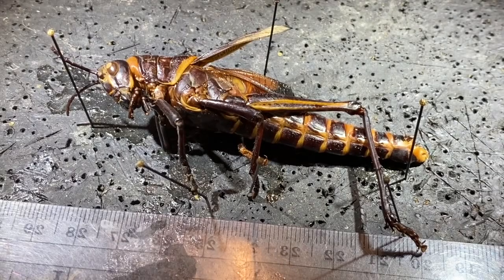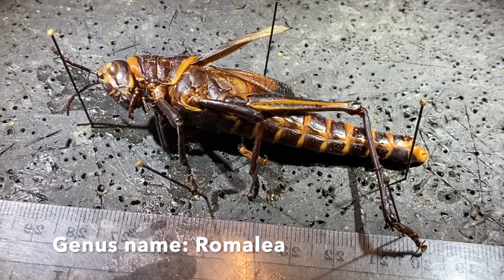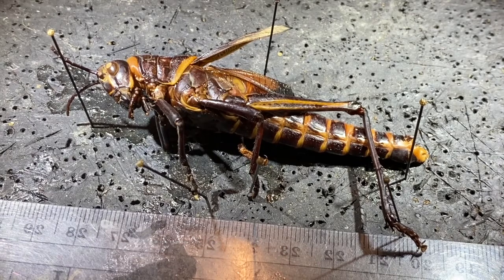In this video, we're going to take a look at the anatomy of the grasshopper. The grasshopper we're using is commonly referred to as a lubber grasshopper. They are quite large. This one, from the tip of the head to the tip of the tail, is about 8 centimeters long. We're going to look at the external anatomy first, and then we'll look at the internal anatomy.